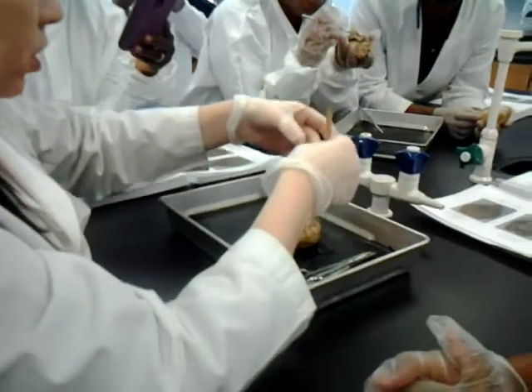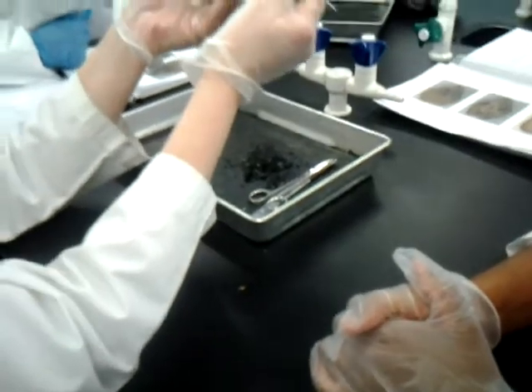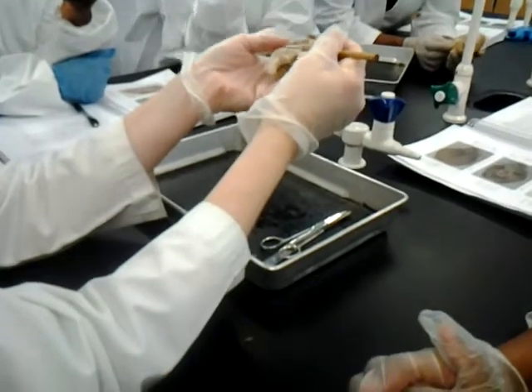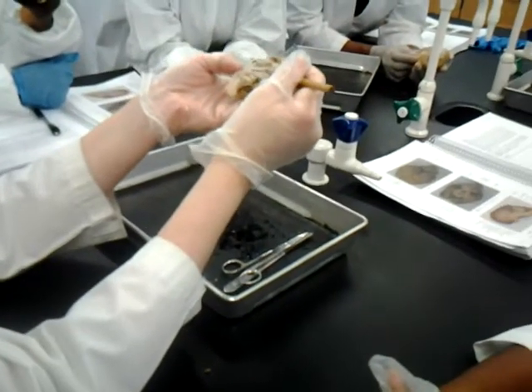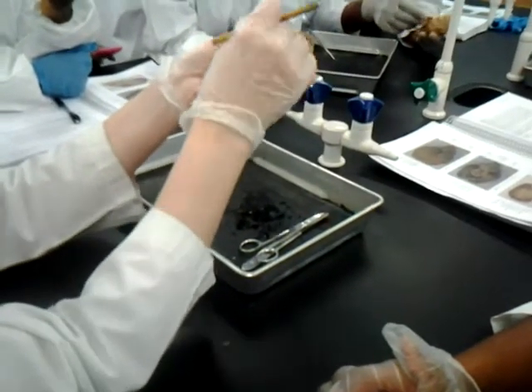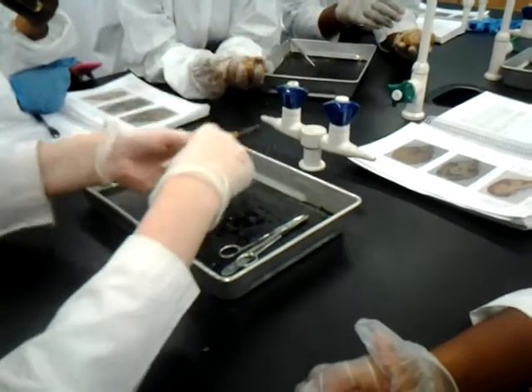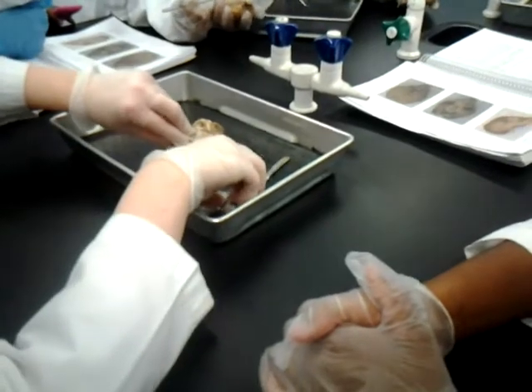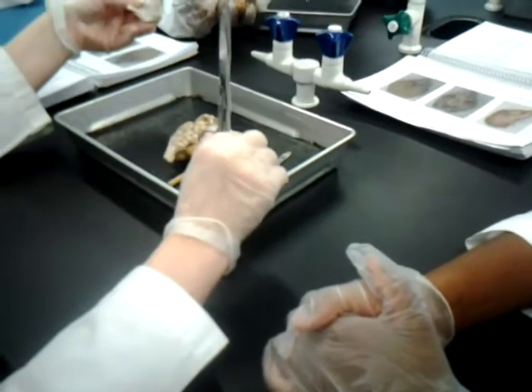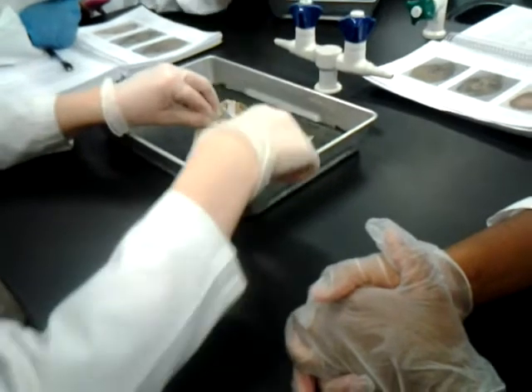Now, when you first go to work on your sheep, I was saying be careful of not ripping this little thing off. On the outside is the dura mater. That actually would cover this whole sheep, but they've cut all of it off except right here. When you go to remove it, you need to be oh so careful about lifting it up, because if you just rip it off, you're going to rip nerves off with it, and some that you need to know. Just the ones that we did on the plastic model, that's what you need to know in here as well.